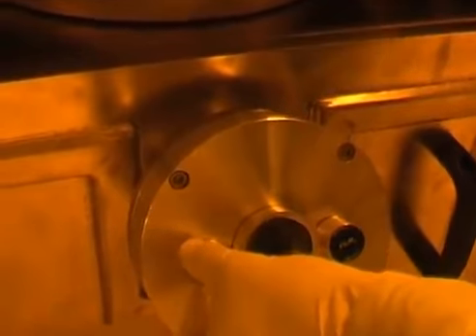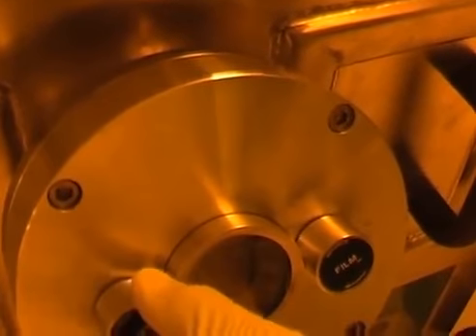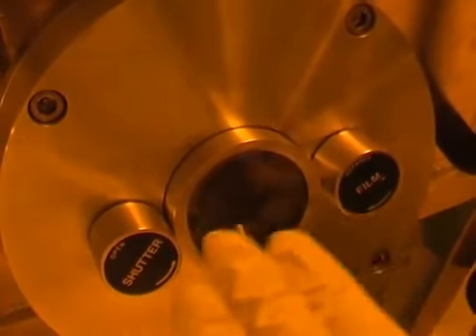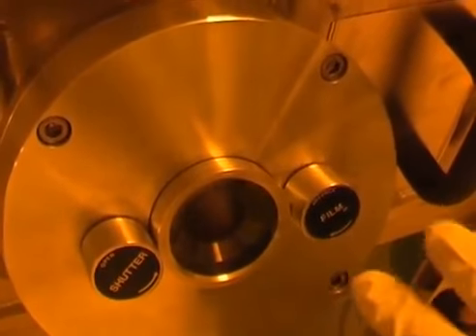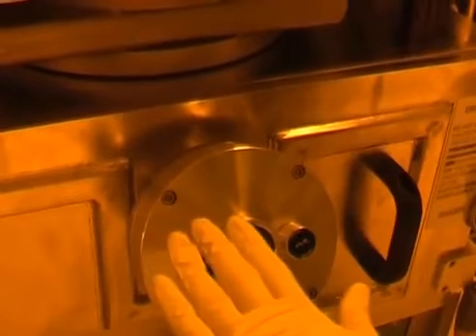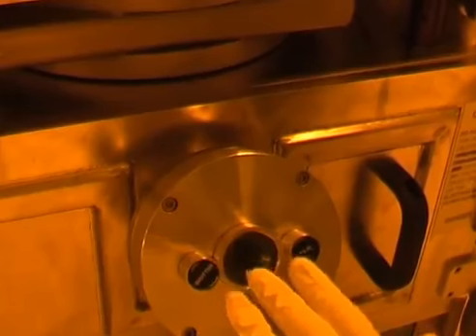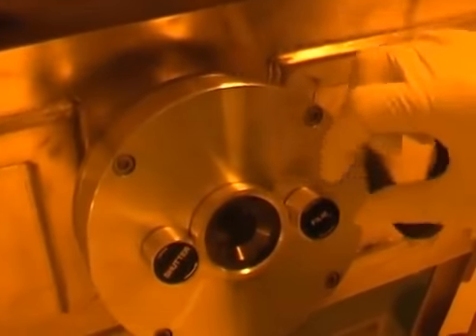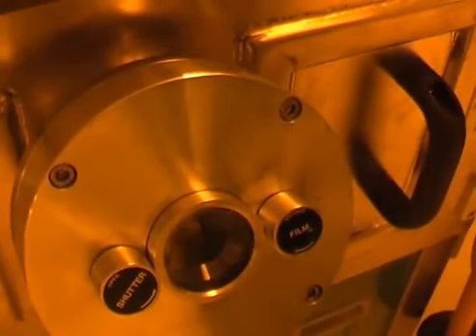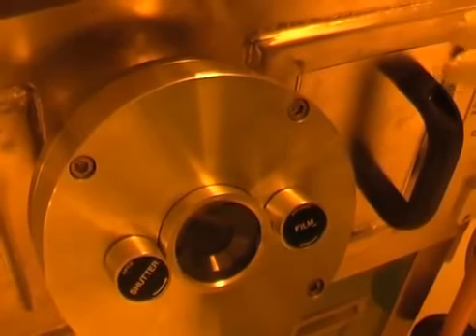Normally, after I have checked that the crucible is working, it's always good to close the shutter, because otherwise the window is going to be coated in metal. The shutter is actually a perspex film, and it will eventually get covered in metal, and in order to advance it, I can rotate this knob here, which will advance the perspex film to a fresh bit of it, so that I can keep looking at the metal being evaporated through this window.